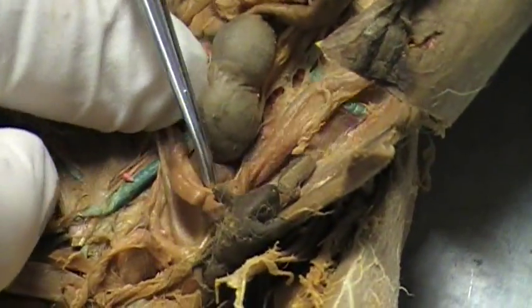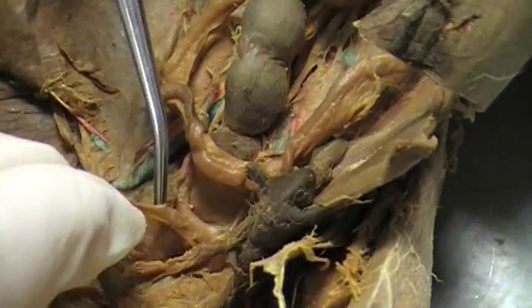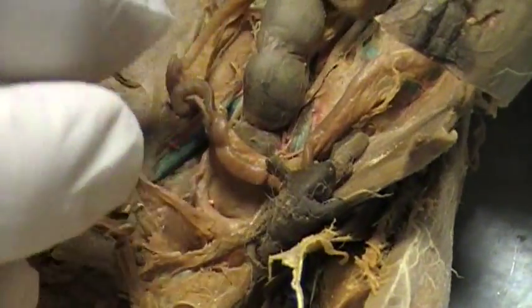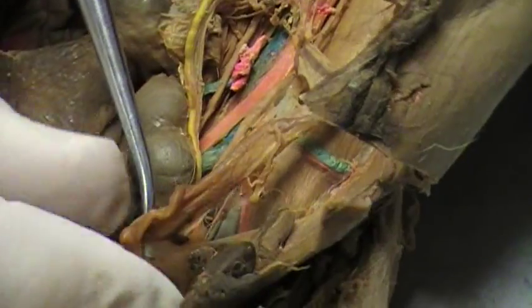This is the uterus right here. This is the bladder. Let's see if the ureters are connected. Here's the ureter — the ureter comes down and it should go into the bladder right there. There's a kidney on this side. Oh, there it is. Here's the ureter on the right side — it comes down right here and it goes into the bladder.